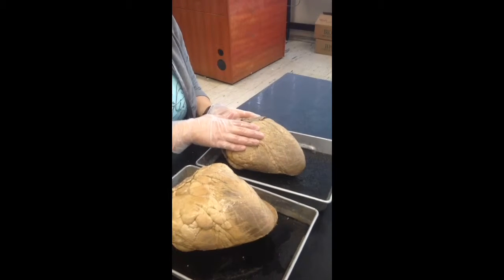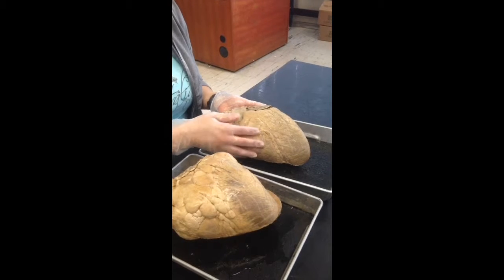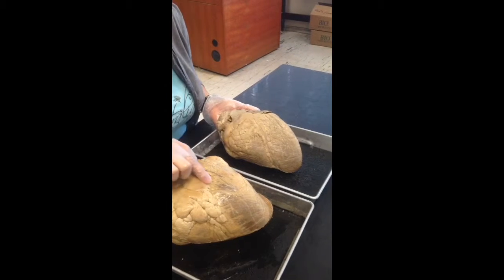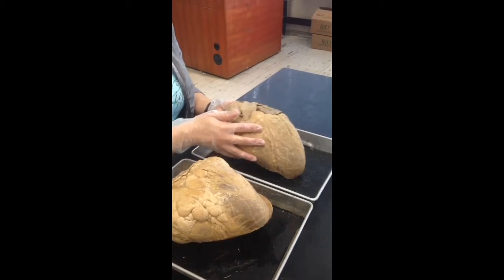Again, the tissue of the heart is the pericardium or visceral pericardium, same thing as epicardium. This is the base of the heart. This is the apex. The groove right here, you kind of see it right here. It's just a slight indentation. That's the interventricular groove.